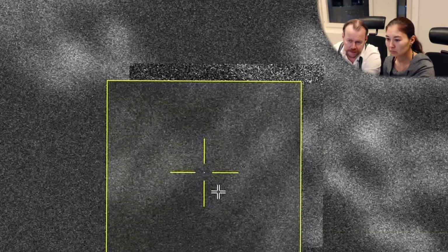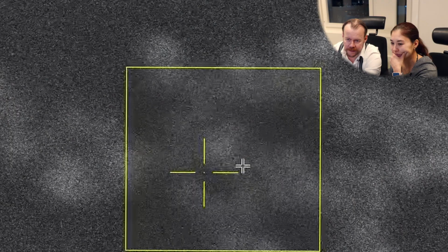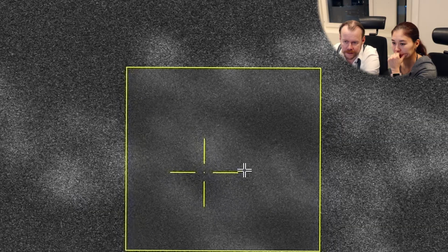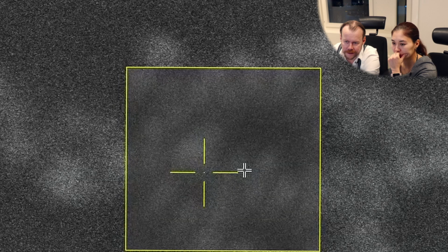Now you should see how it looks like. You see, you can change the wobbler intensity. If you pull that down a little bit, it becomes a little bit easier. You see, no, wait. Sorry. You see, I think it was pretty good as it already was, right? Okay. Yeah. So the column centering is fine, but the astigmatism we can improve, right? See here, it becomes a little bit lineish. Very little there. Try to see if you can adjust a little bit.